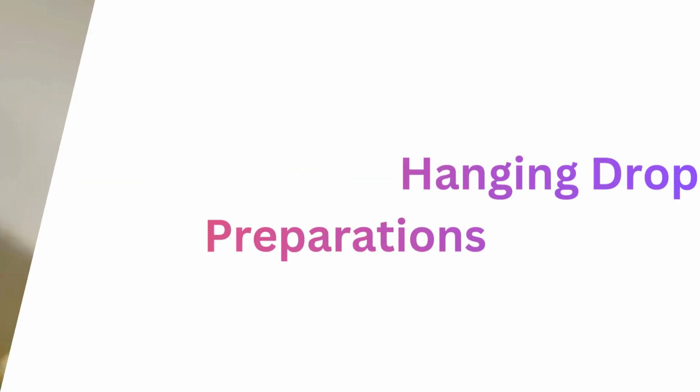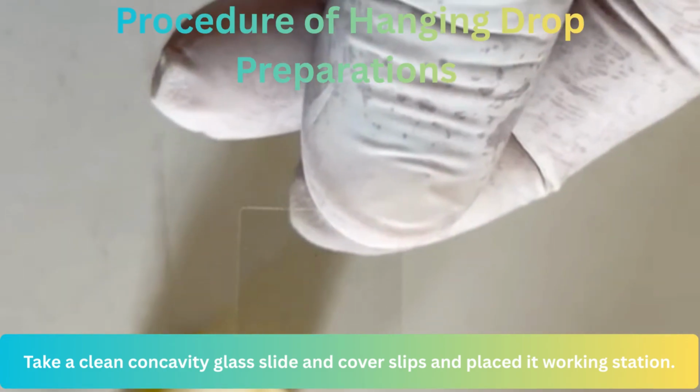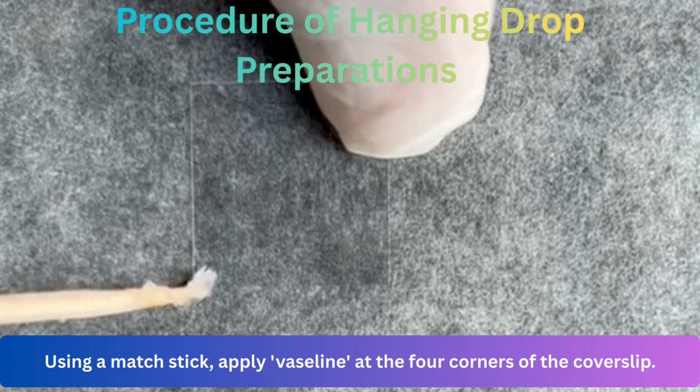Now I am going to demonstrate the procedure of hanging drop preparation. First we need to take a clean cover slip and place it on the working table. After that, take a wooden cotton stick and apply petroleum jelly on each corner of the cover slip.